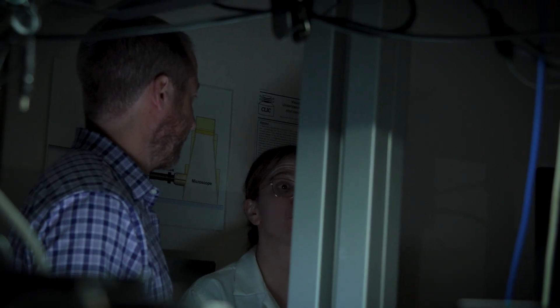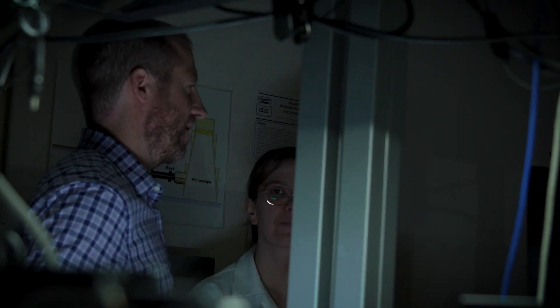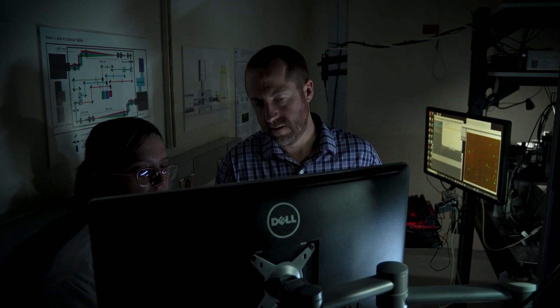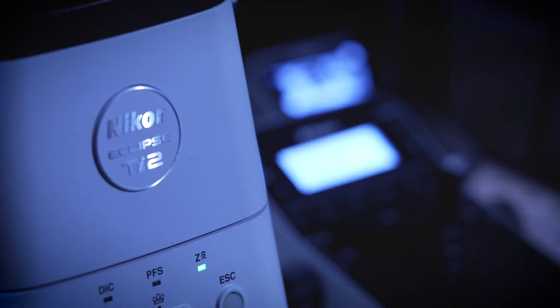Dr. Leslie first approached Nikon about 10 years ago. She was looking for a very custom solution that wasn't already available in the marketplace. That's something Nikon loves to do — figure out all these different third-party modalities and ways to bring together a system that meets the research needs.